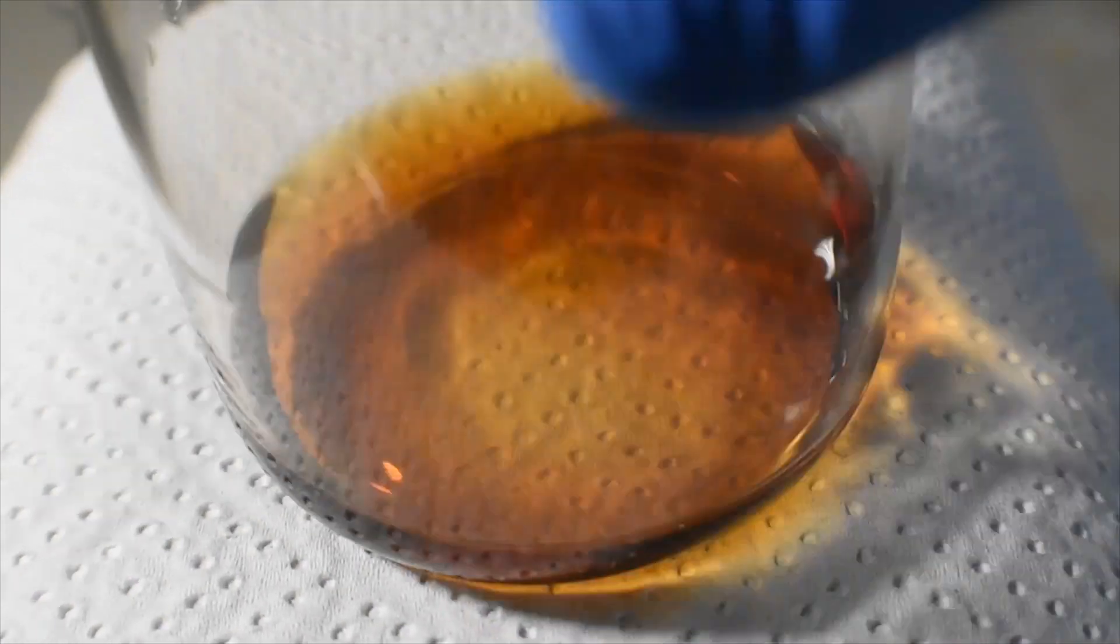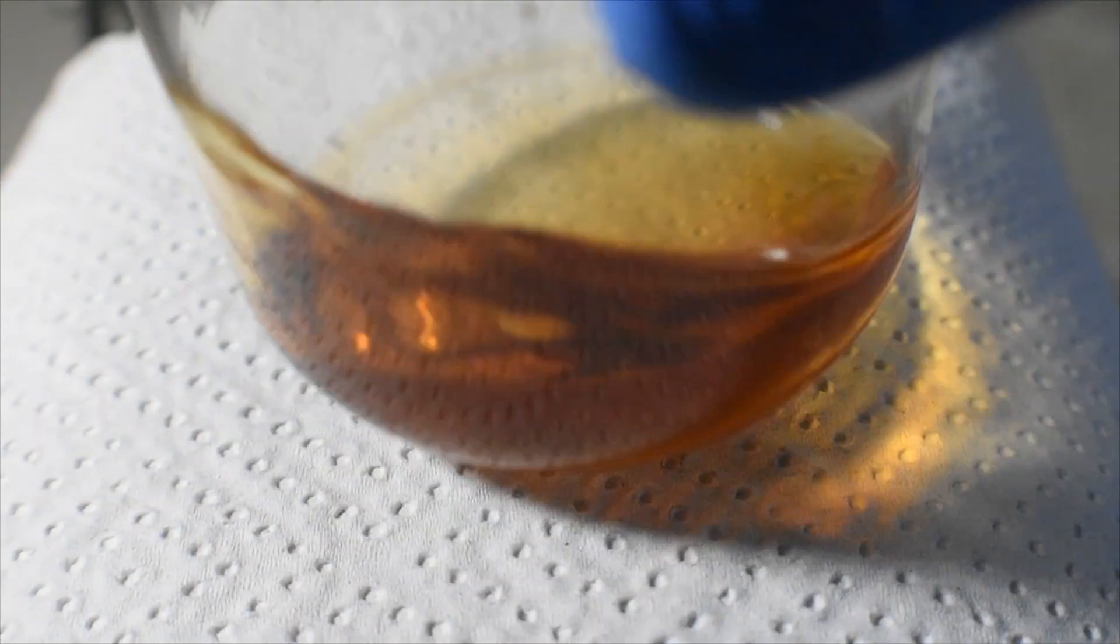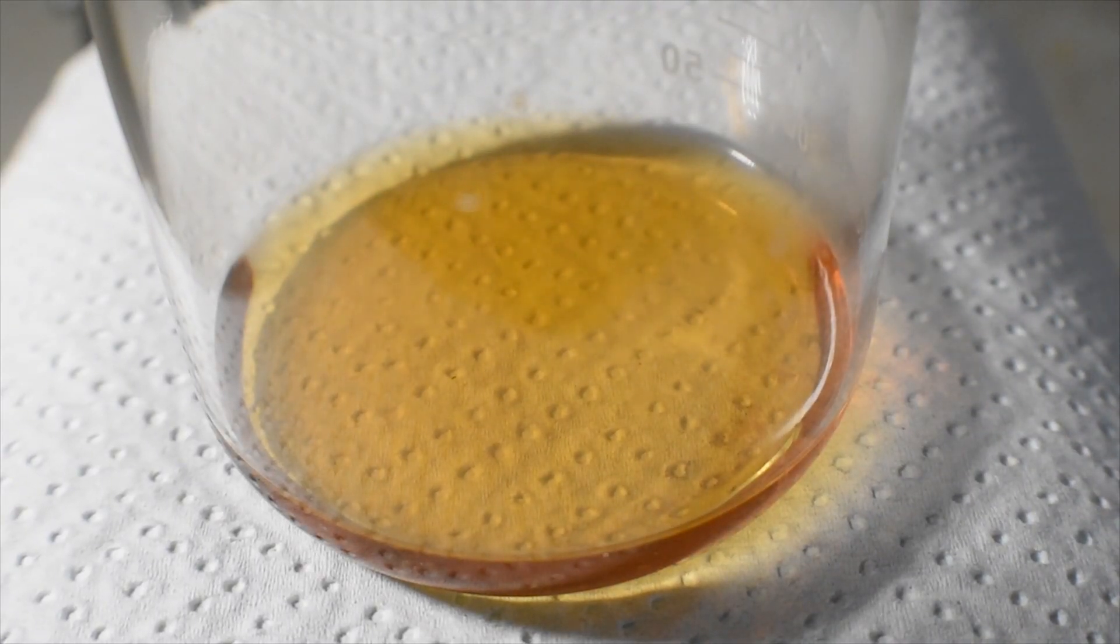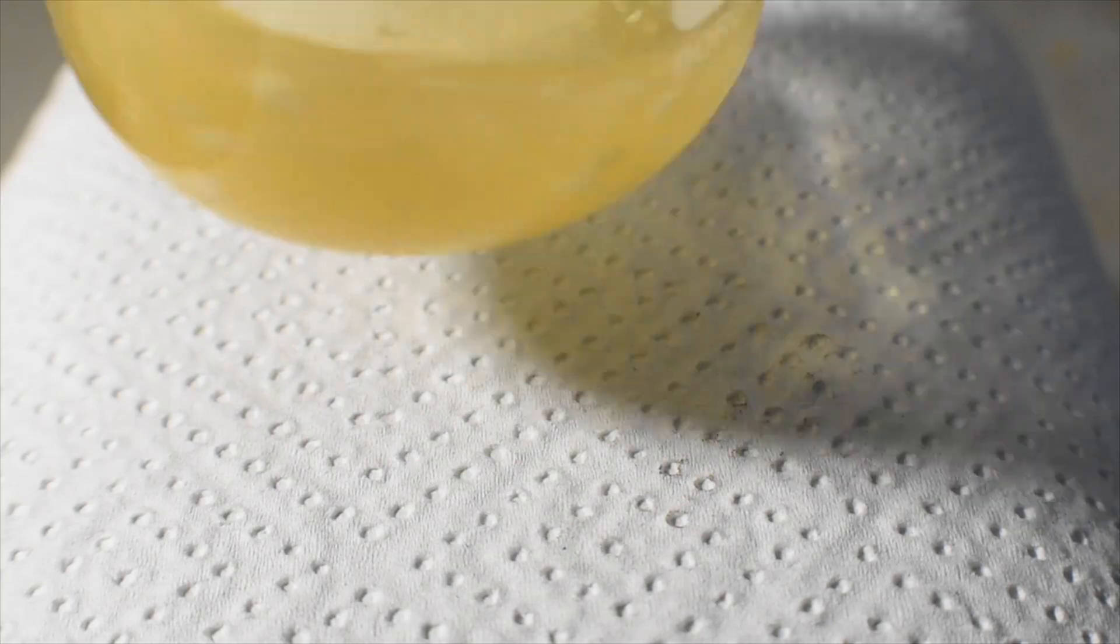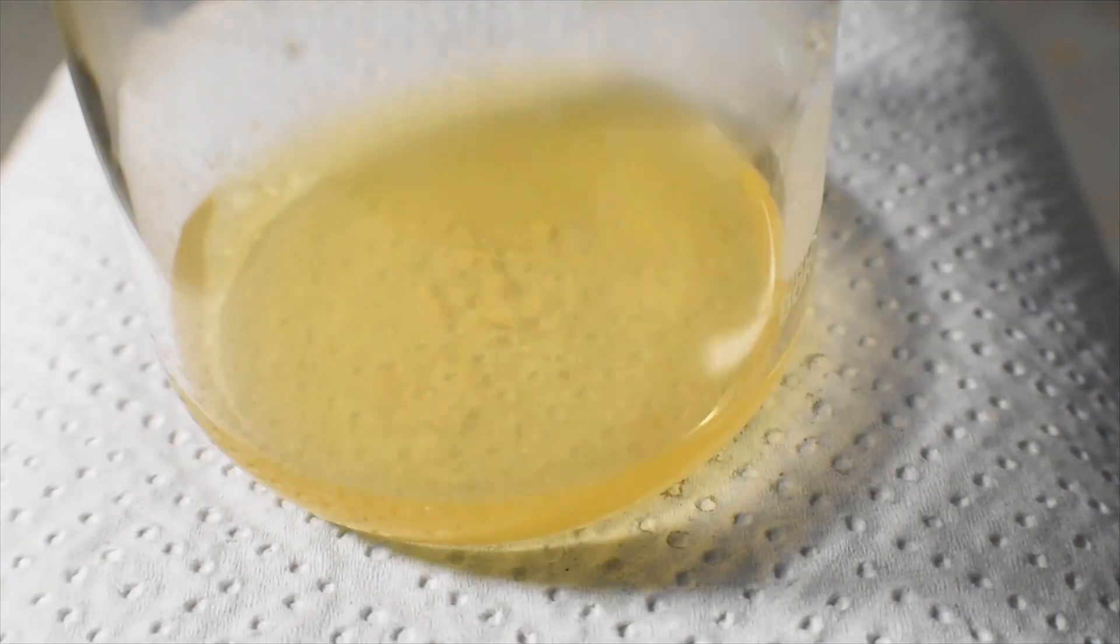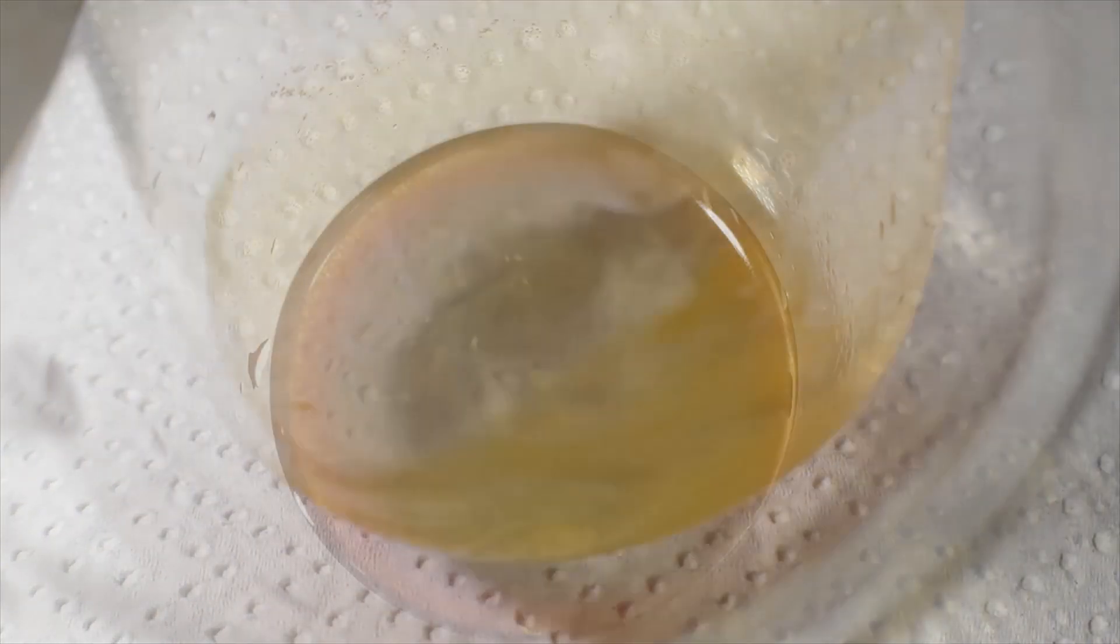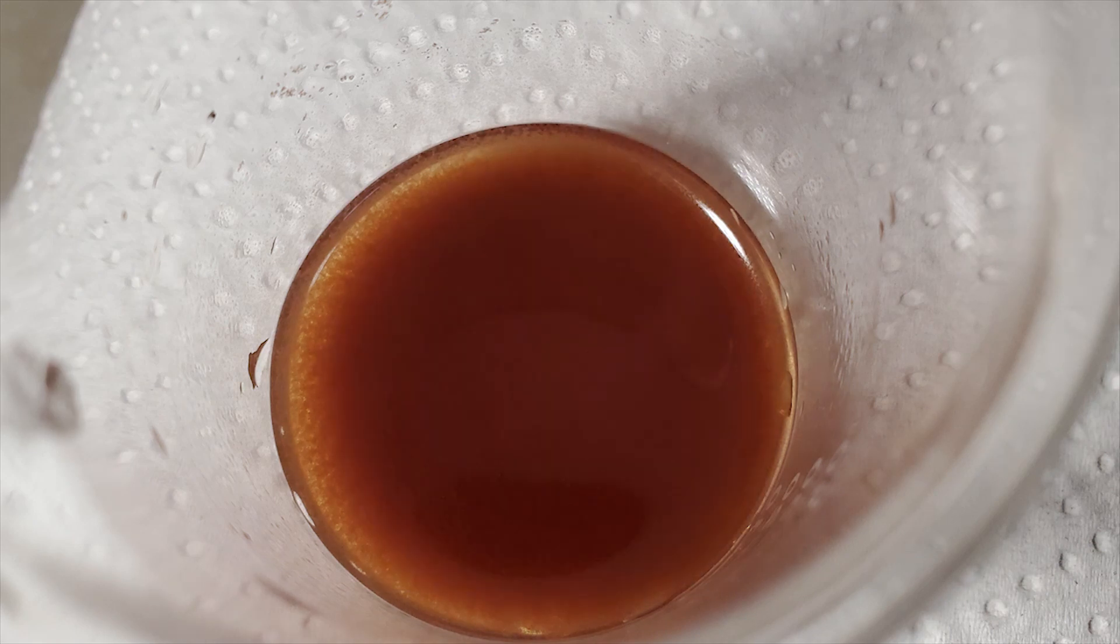Unfortunately, this did not produce any precipitate, and I'm not super surprised by this. The conditions are pretty dilute here, and when I concentrated things up a little bit later, I found that I got a precipitate, so I think that it worked.